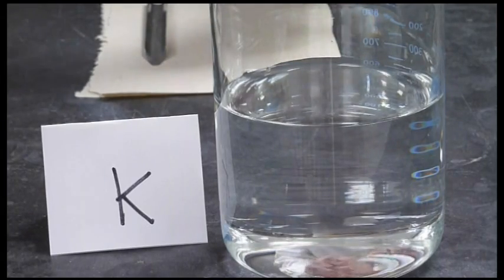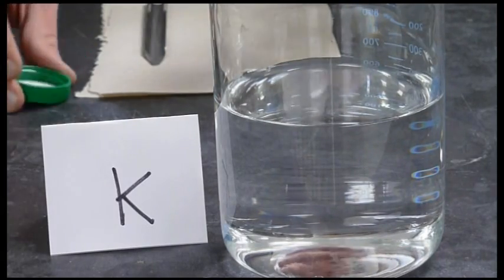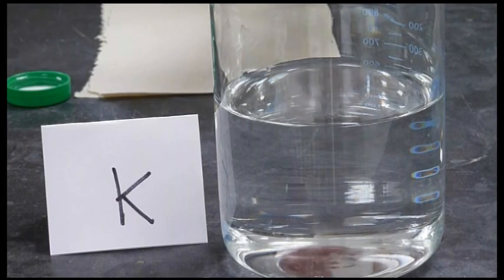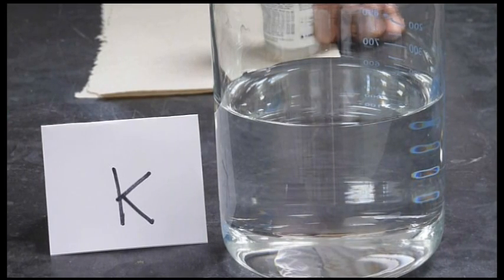The last alkali metal we're going to react with water is potassium. Let's see how potassium reacts with water.